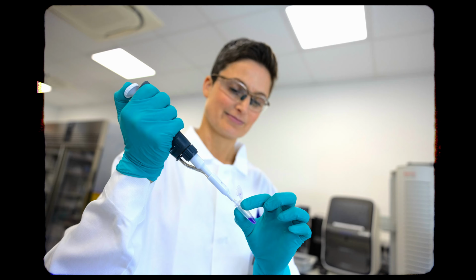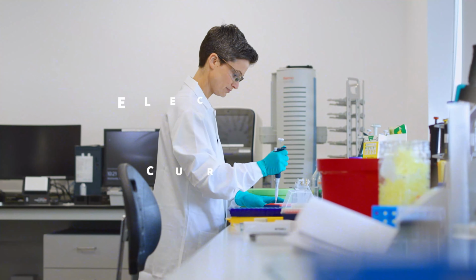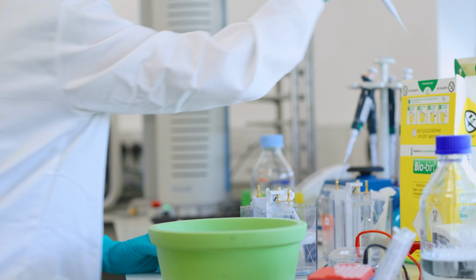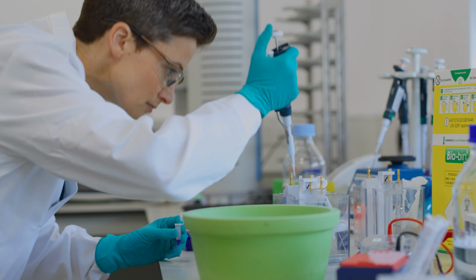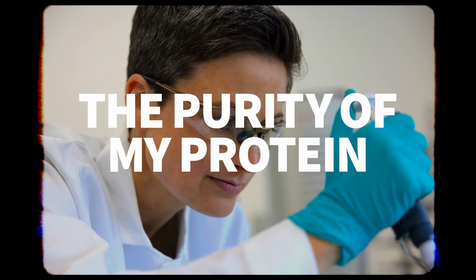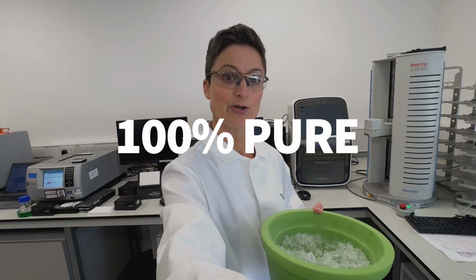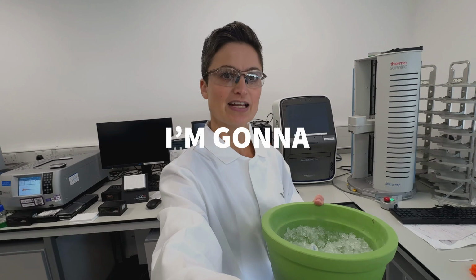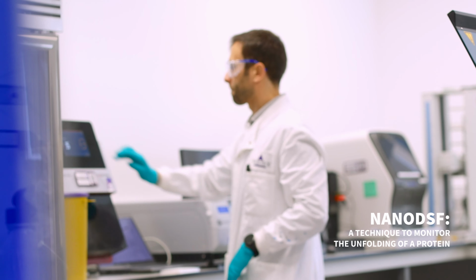I'm going to load a small sample of my protein into this gel. You add an electrical current and that will move the protein down through the gel. The gel will separate the proteins in that particular solution, again on the basis of size, so I can determine the purity of my protein. So I've got my final protein, which is 100% pure, ready for grid, so I'm going to hand it over to Chady now. And now I'll be performing the final quality control step using the Nano DSF.